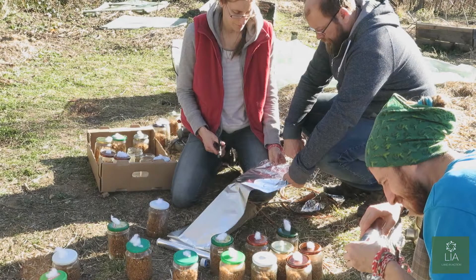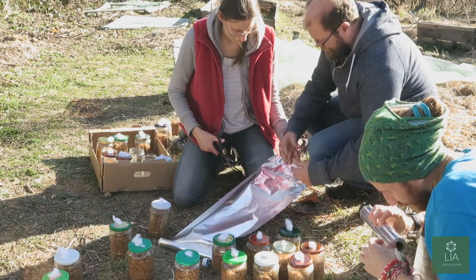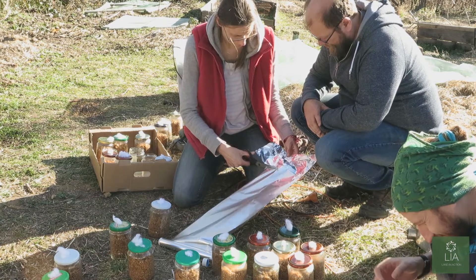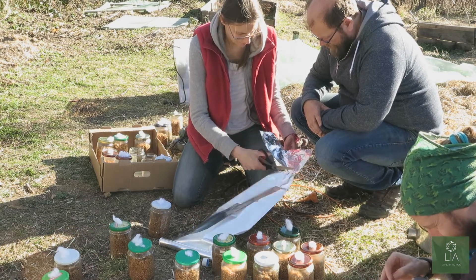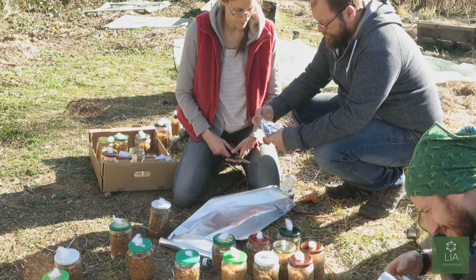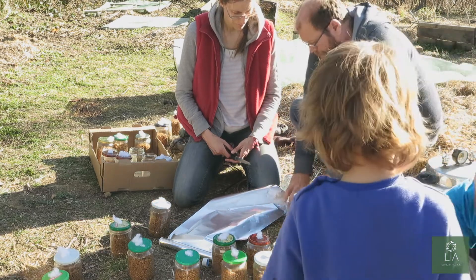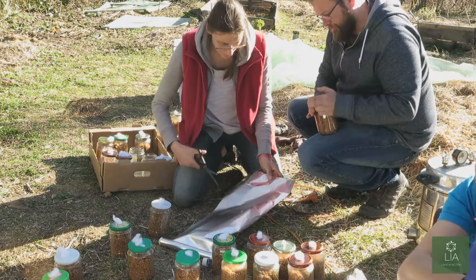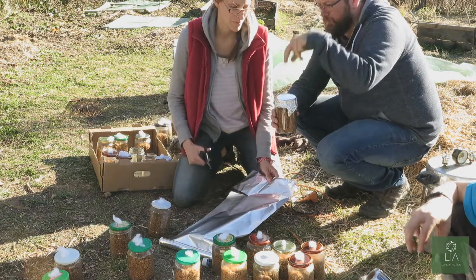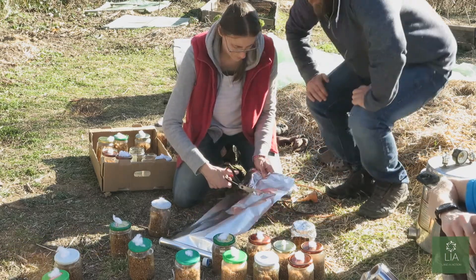You need a piece of foil a little bit wider than the jar. If the foil is long enough, fold it in half — so a bit wider than the jar, fold it in half, and then place that over the jar. This will allow steam to get in but won't allow any water to drip down from the top while it's cooking.